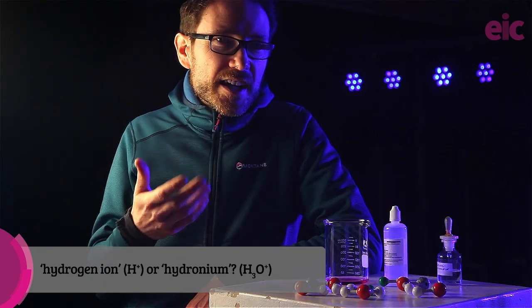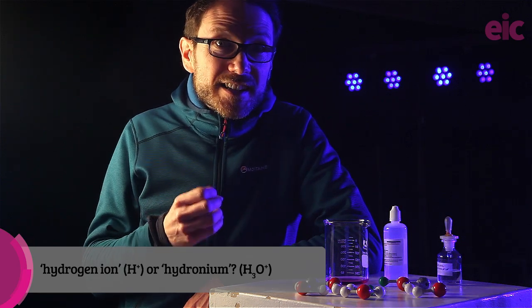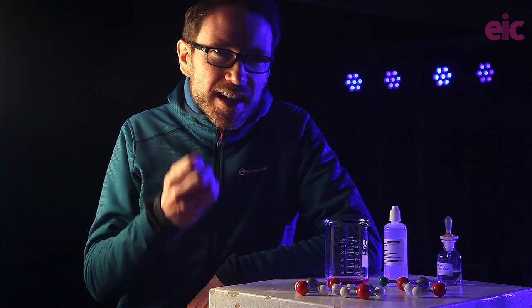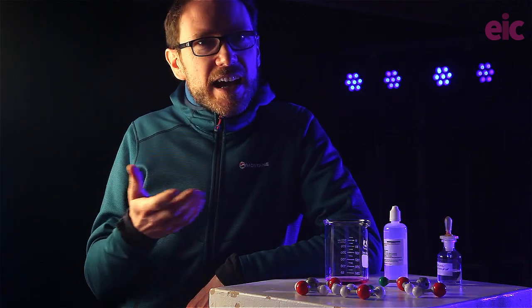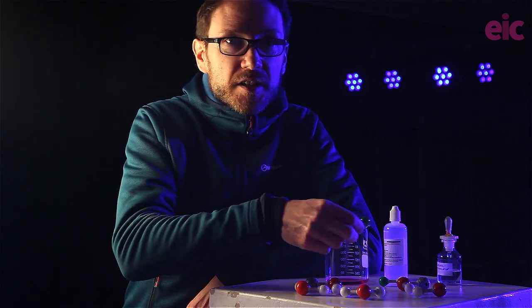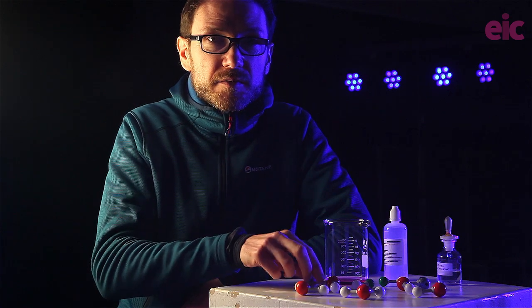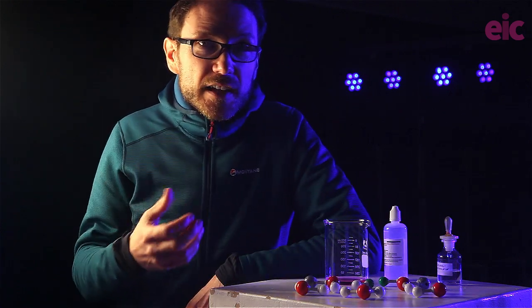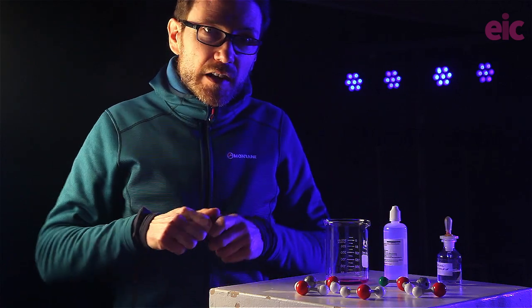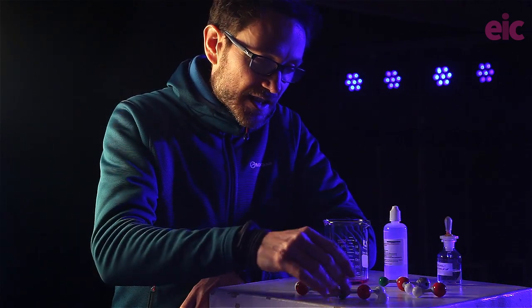At least until next time, when we'll need a more subtle model to explain some of the effects that we'll see. What we want students paying attention to at this level is that acids are solutions containing hydrogen ions, and alkaline solutions are those containing hydroxide ions. Specifically, when they write the formula for HCl, we want them to be able to visualize the ions dissociated into solution, not as molecules.